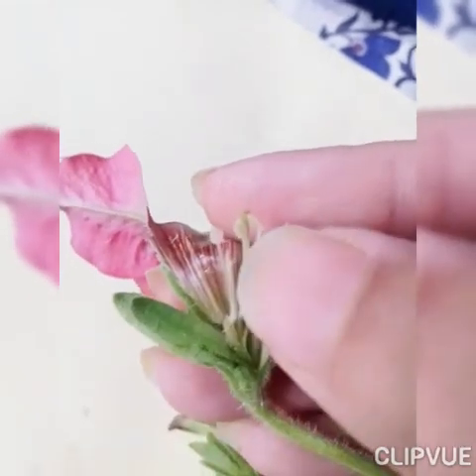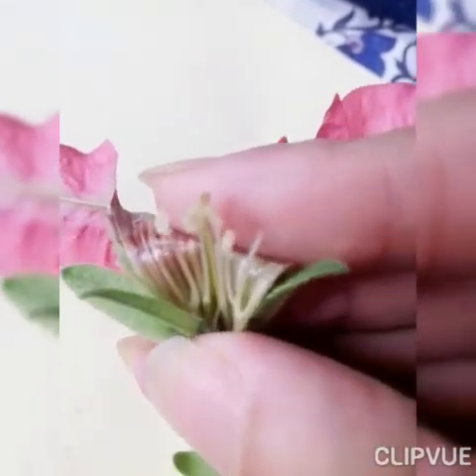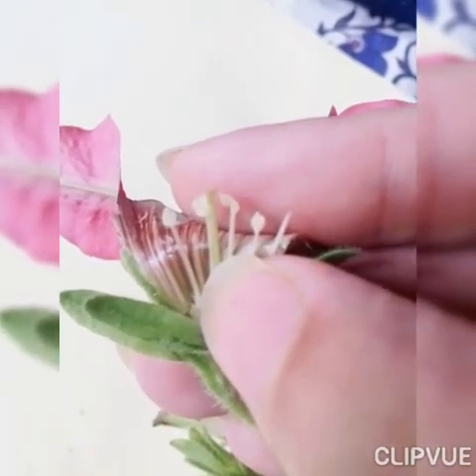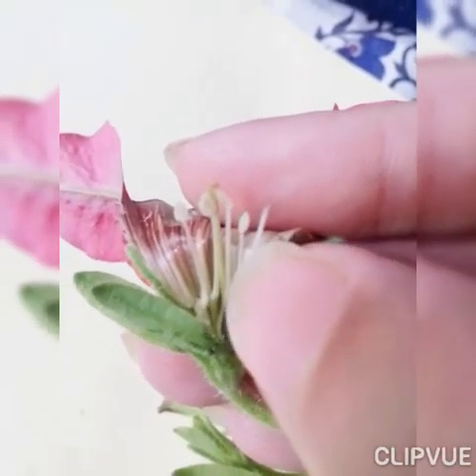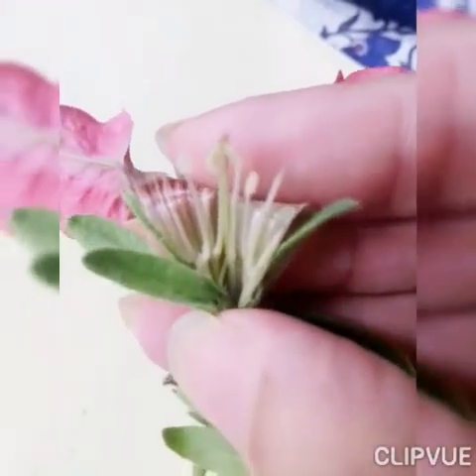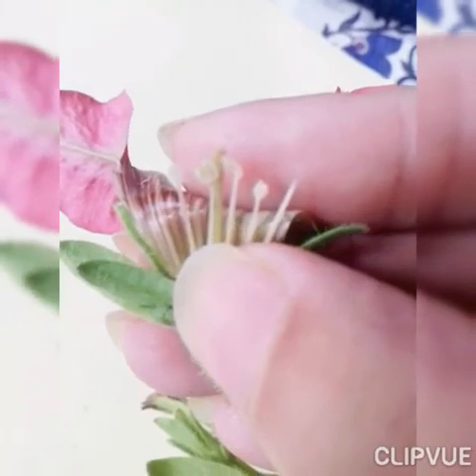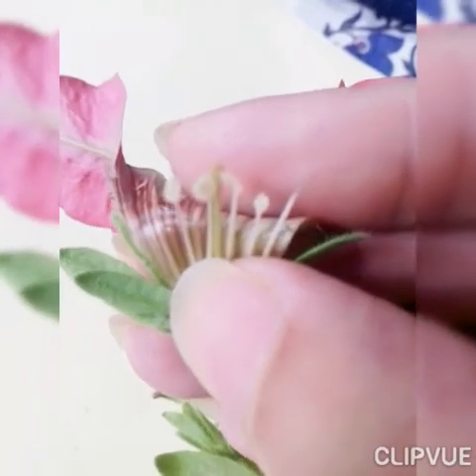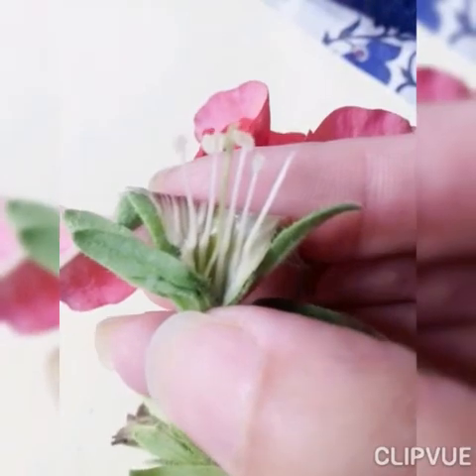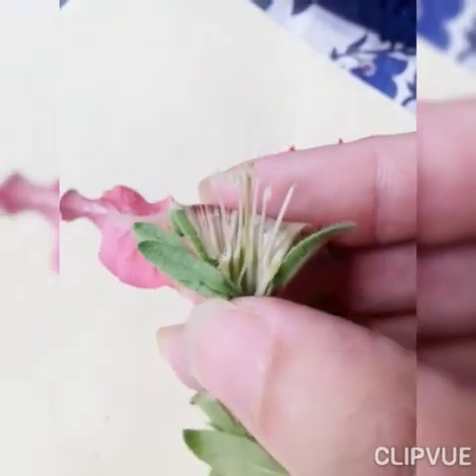You can also see the carpel, which is basically the female part of the flower — the middle one. This is the carpel, and these are the stamens, the male part of the flower. Stamens collectively are called the androecium, and the carpel collectively is called the gynoecium.